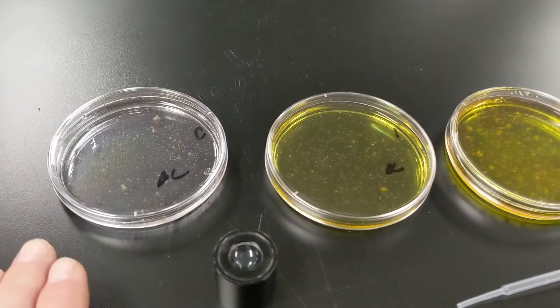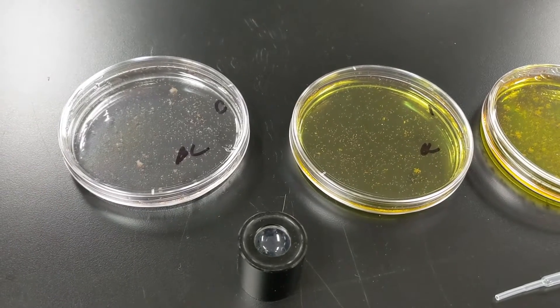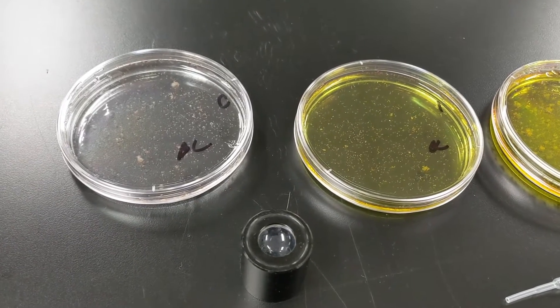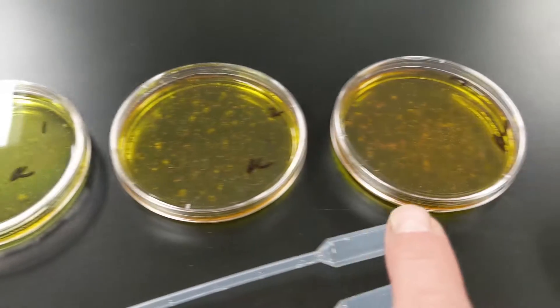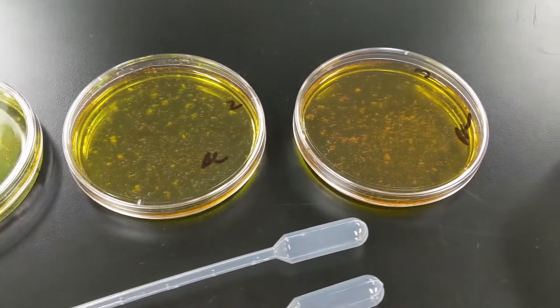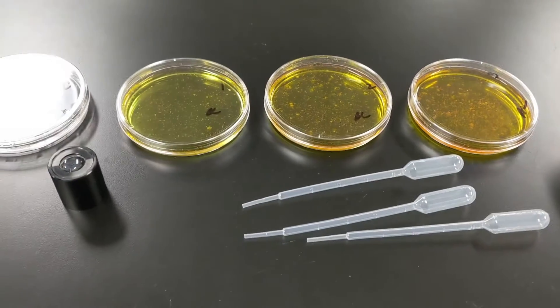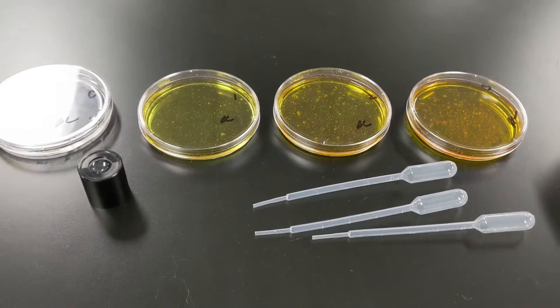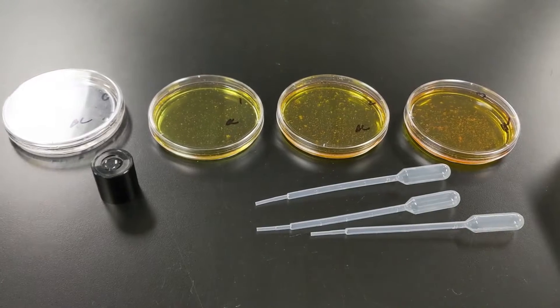You always need a control. The control is the unchanged part, the original recipe. And then here I have an increasing amount of my experimental contaminant, and I want to see what the effects of this are on brine shrimp hatch rate.